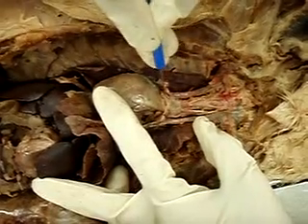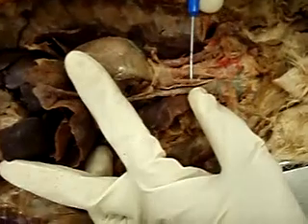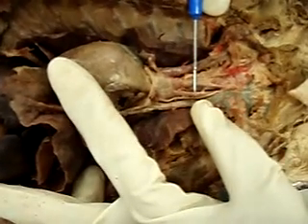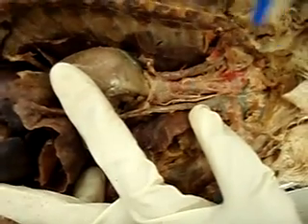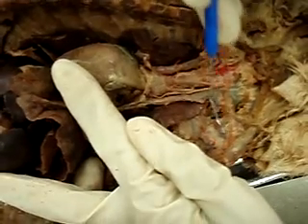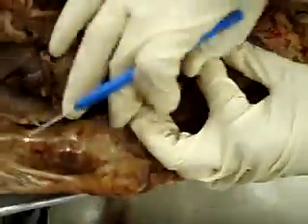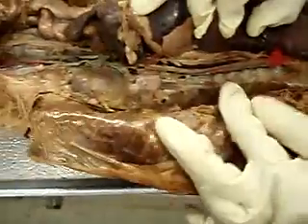So going back, so right subclavian artery, right common carotid, left common carotid, brachiocephalic, aortic arch. Also coming off the aortic arch is the left subclavian artery, is right here. It's called subclavian because it goes under the clavicle: subclavian, clavicle. So that's the way to remember it.